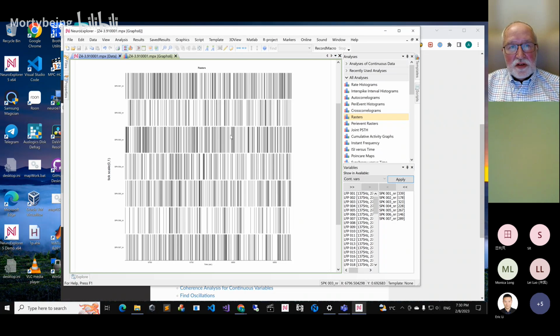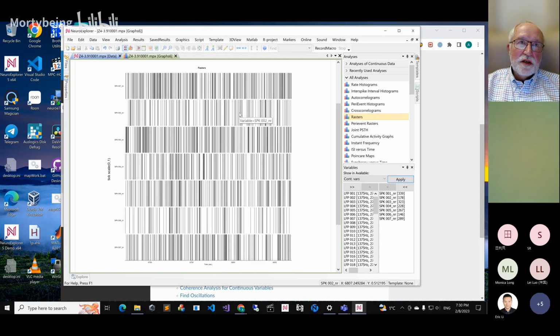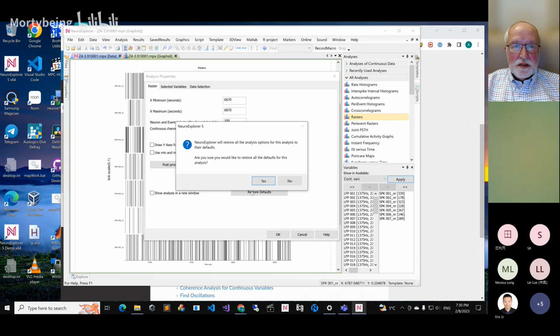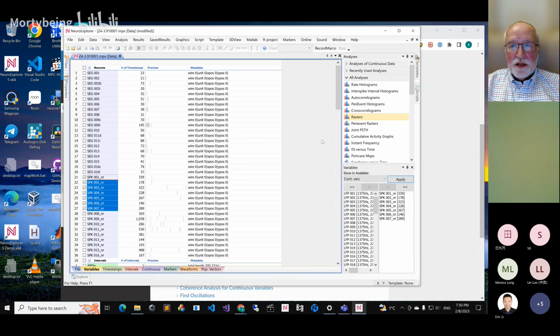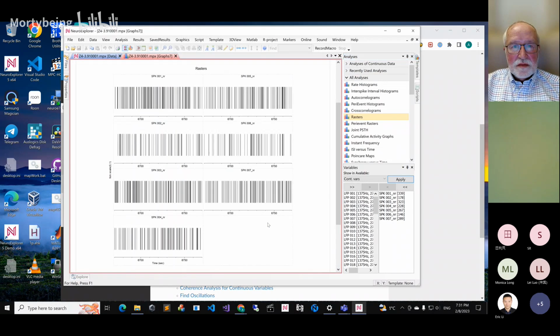So you see, you just have the ticks for the channels. Actually, I changed the standard analysis options a little bit. For example, this is for a customer who wanted to see so-called network spikes. There is a script that draws rectangles with the spikes that happen on many channels. If you see something weird that doesn't look normal, you double click and press restore defaults. It will restore defaults for this analysis. So if you go back, now we specify 6670, 6770. So this is your default raster analysis.